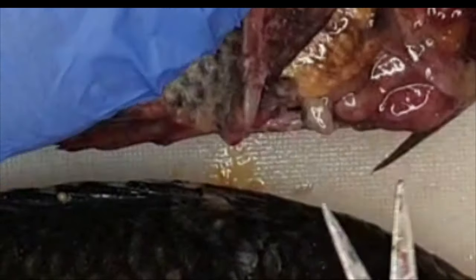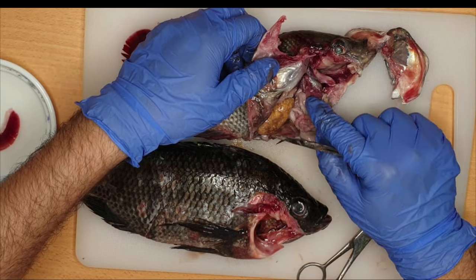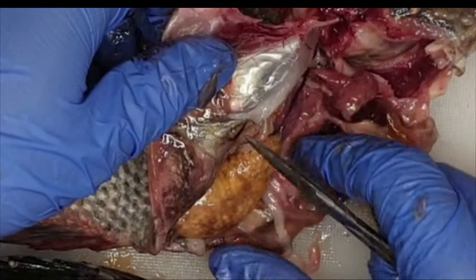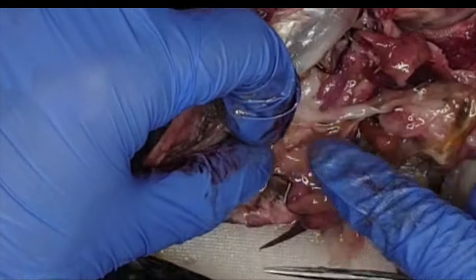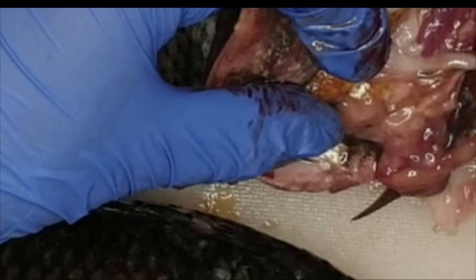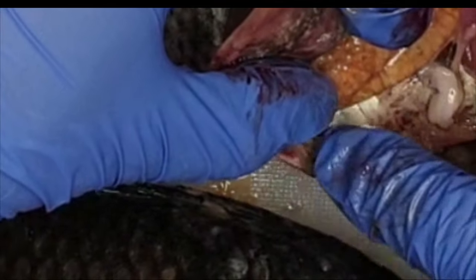Now it is much more obvious. This is the liver, and here we have the stomach. After the stomach there is the intestine. Those are the intestines, and eventually they open into the cloaca. So in the digestive tract: the mouth opens into the pharynx, the pharynx opens into the esophagus, the esophagus opens into the stomach, then intestine, and finally into the cloaca.